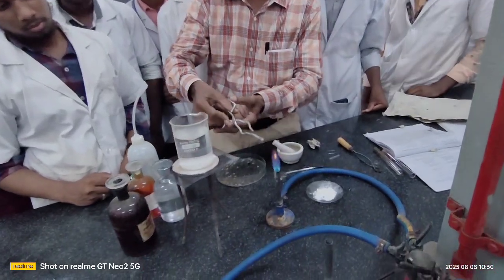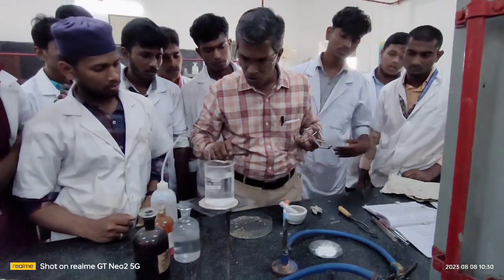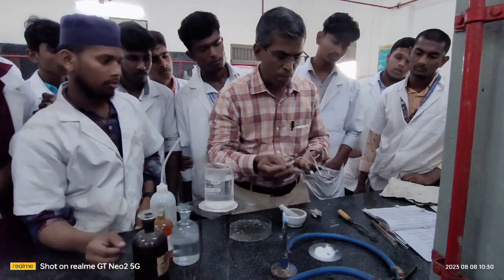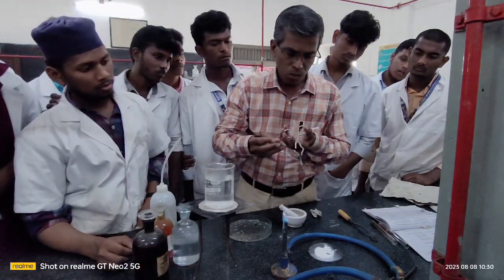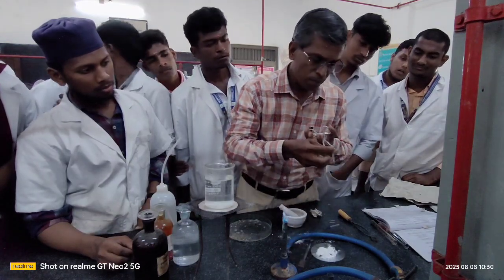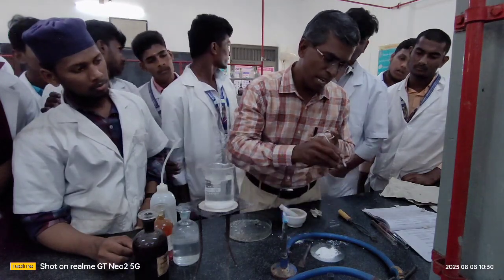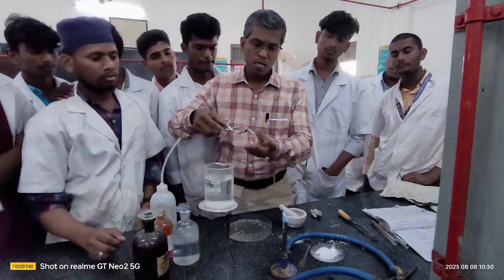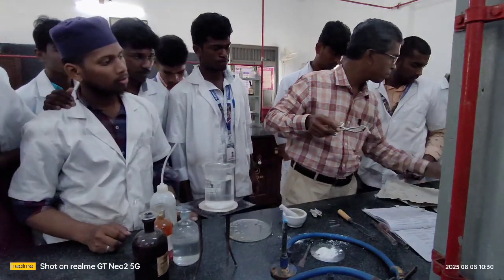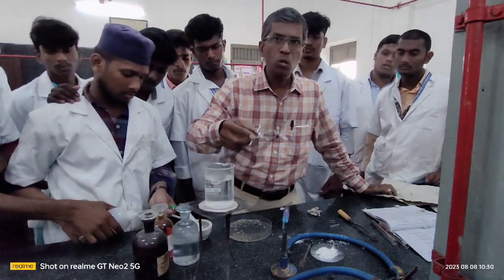Yes, already melted. Now you take a little amount of your given organic compound. Again I am taking the given organic compound, a little, to this same tube. The compound is taken. Now you take a little water into this. Now do like this.